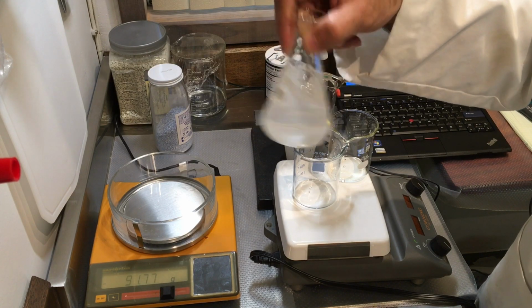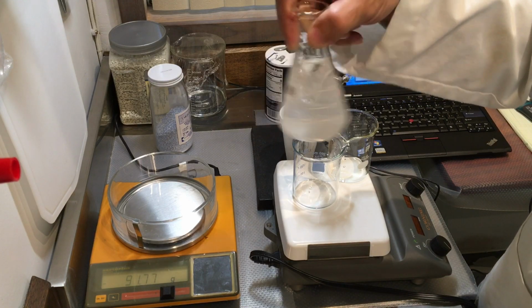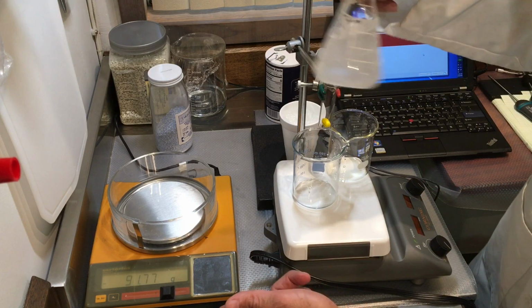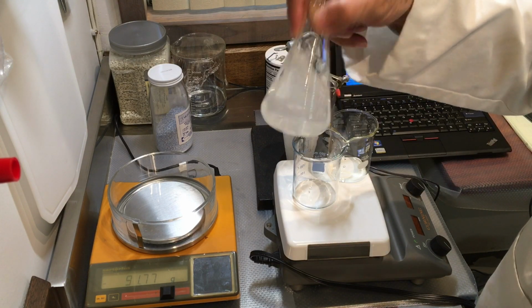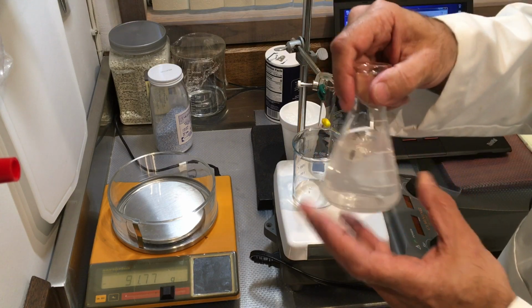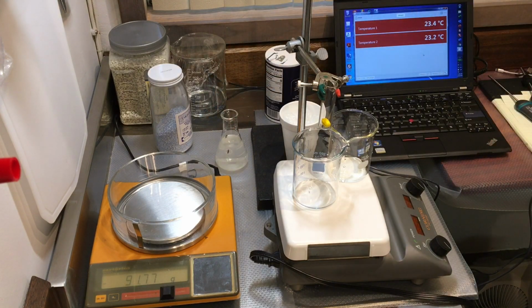So you're going to calculate moles of NaCl that I just massed out, and then you will be dividing it by kilograms of water. So we measured mass of water in grams, converted to kilogram. Mole of the salt divided by kilogram of the solvent. That would be molality of this solution right here. So my solution is ready.